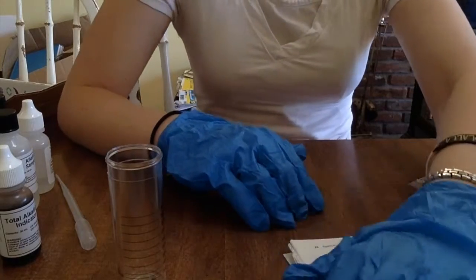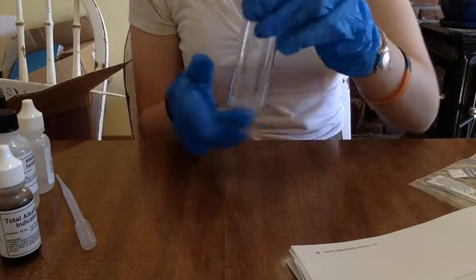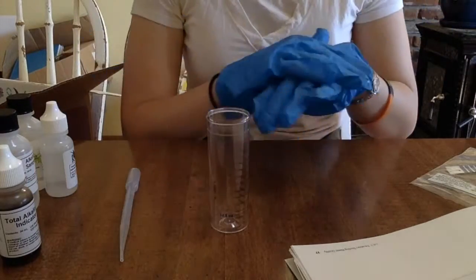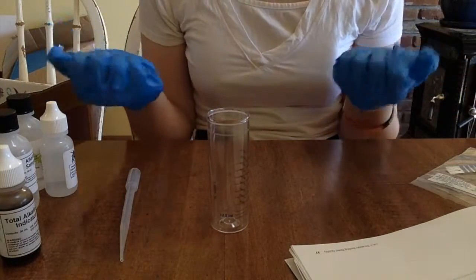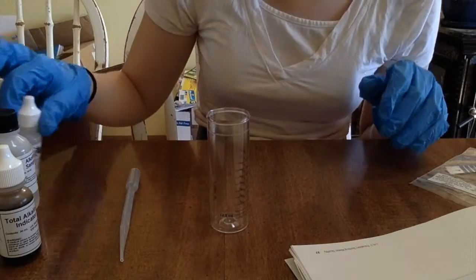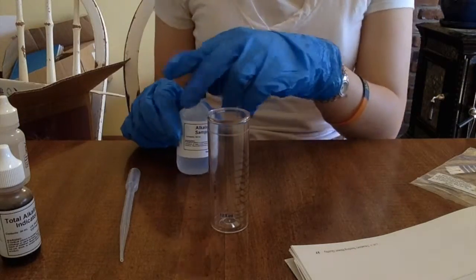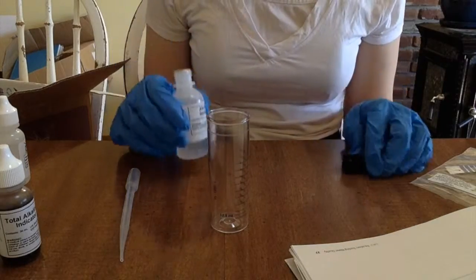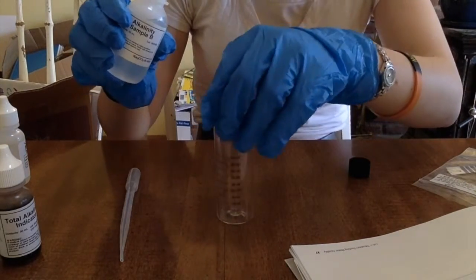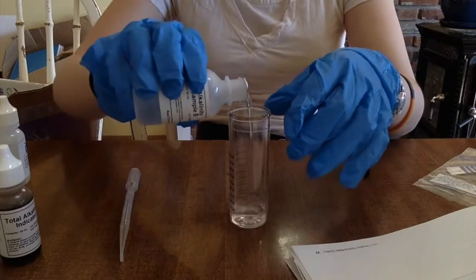And we are back with a freshly cleaned cup, and completely sopping wet gloves inside and out, because I've decided to wash my disposable gloves — because I am brilliant like that. Anyway, we're doing the same exact thing this time, only with sample number B.